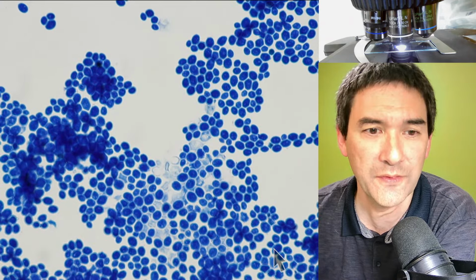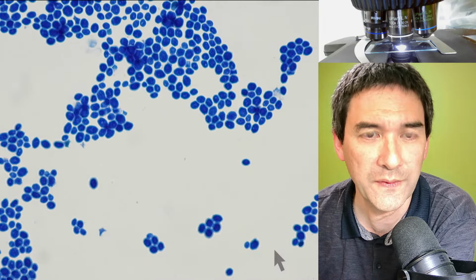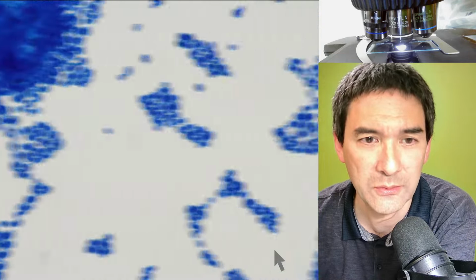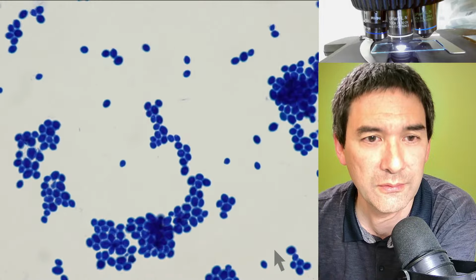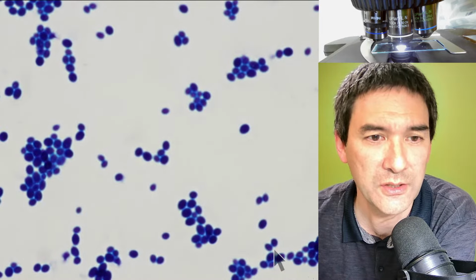You see over here, some of the cells seem to be a little bit brighter. It probably also has to do with how long the stain could actually do its work. Now I'm going to go all the way to the side. This is pretty huge. Maybe I'm trying to find the non-stained parts. Can't find it here. Here the cells are yet a little bit darker.